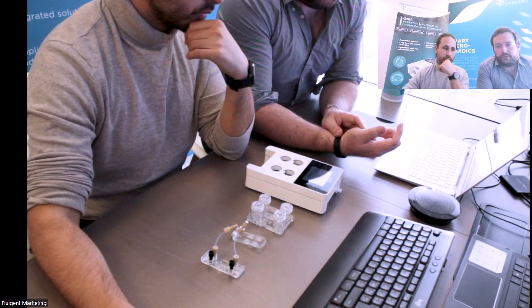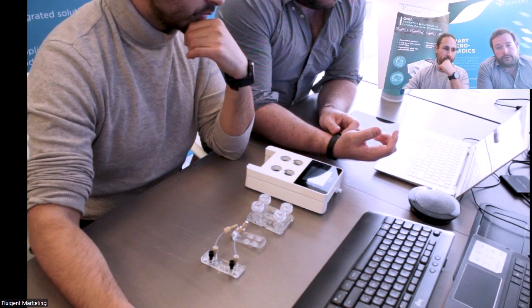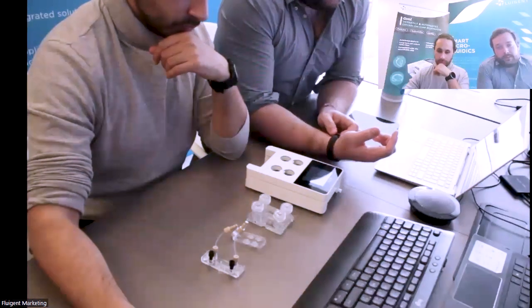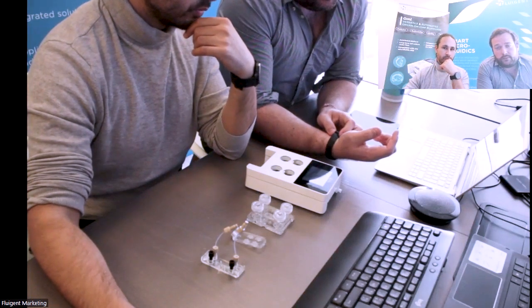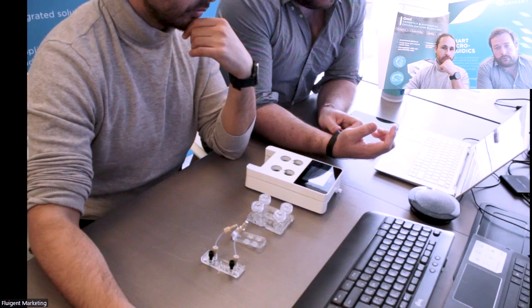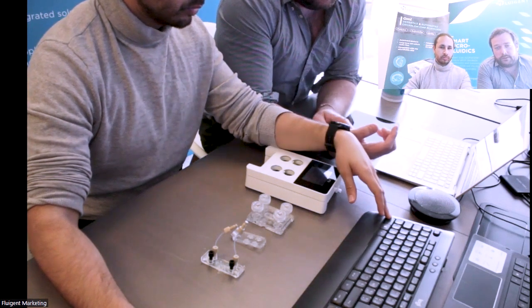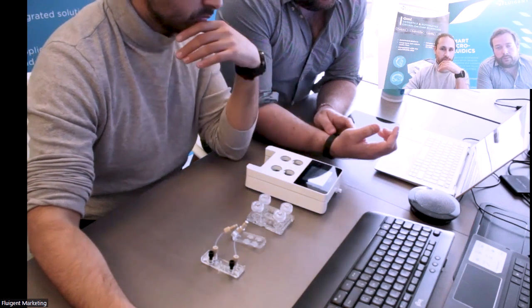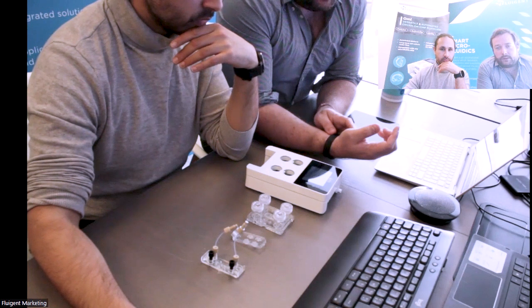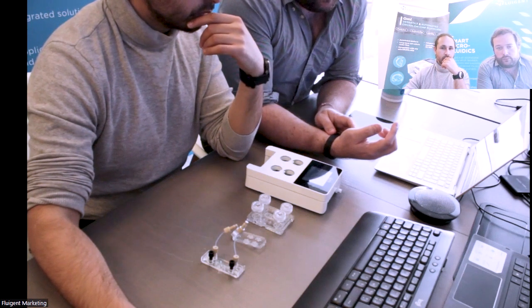In this version, unfortunately, it has not been implemented. It's because you have a security that wants to prevent injecting air to prevent bubbles, so it is not compatible in this case. But depending on your need, if you have some specific need, we could implement it in a future version.